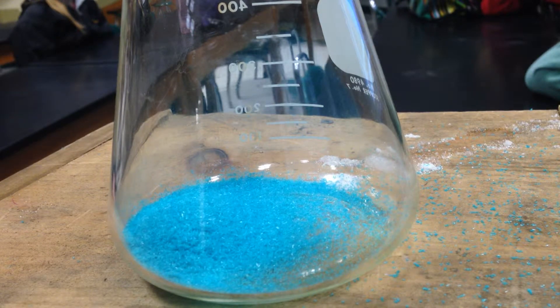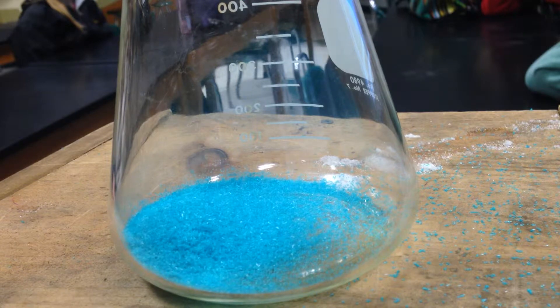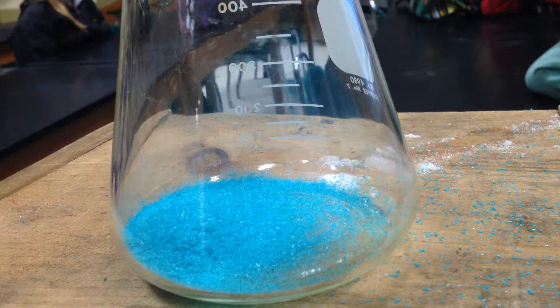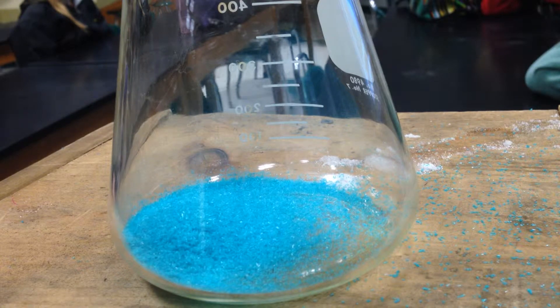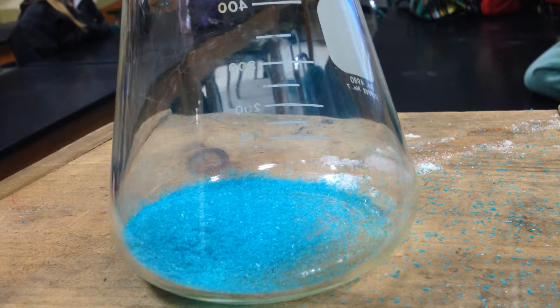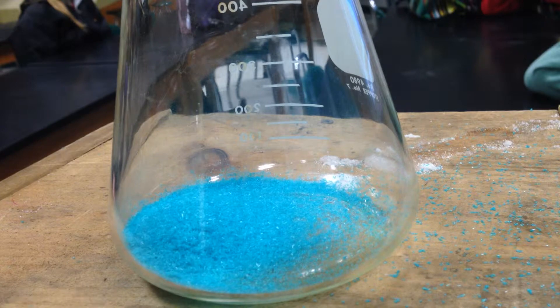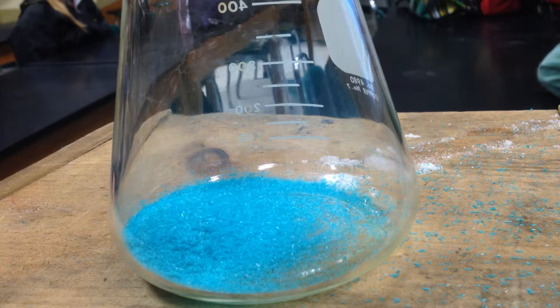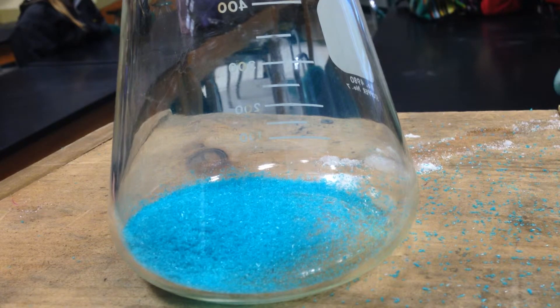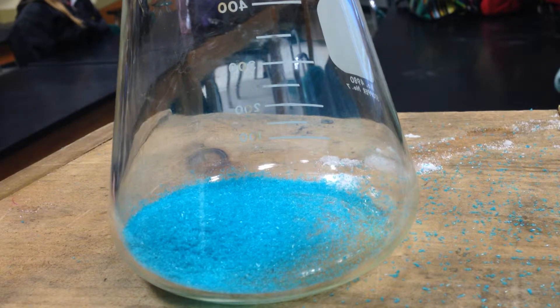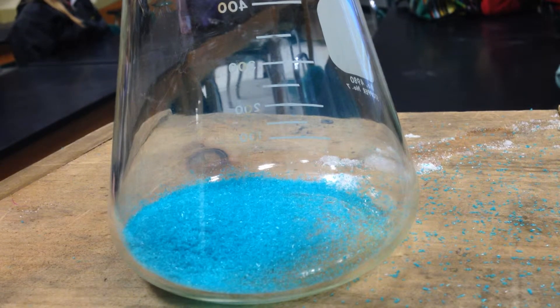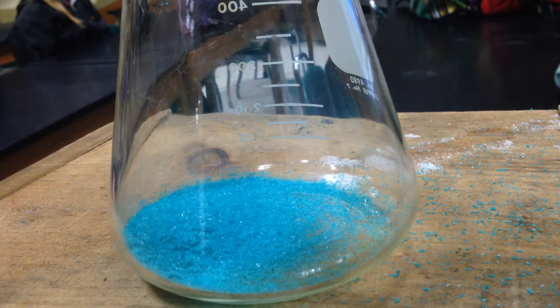So what I want you to observe is the initial color change. This should give me a dark green. When I add a little water here, the predominant ion in the solution is going to be chloride ions. And the chloride ions, being negative, are going to be drawn into copper's d-orbitals. So when I first pour this, we should see a real dark green color initially. If I add too much, then the water becomes the predominant ligand, and that changes the splitting in the d-orbitals. Therefore, it changes the gaps. So I'm going to add some water.